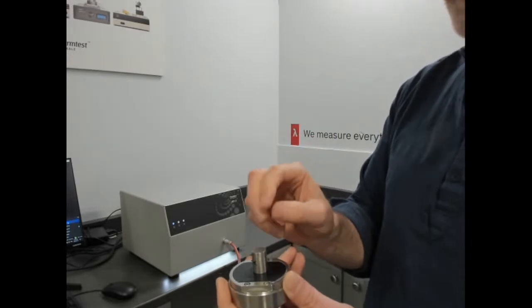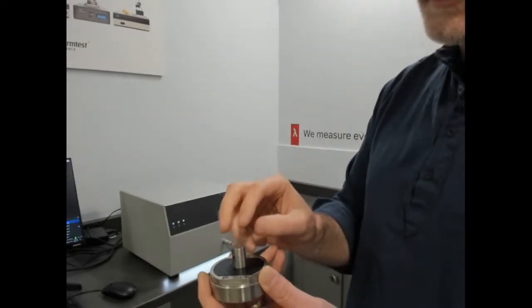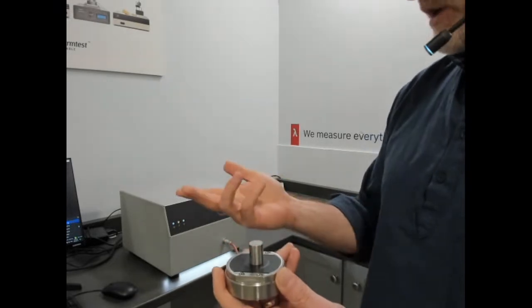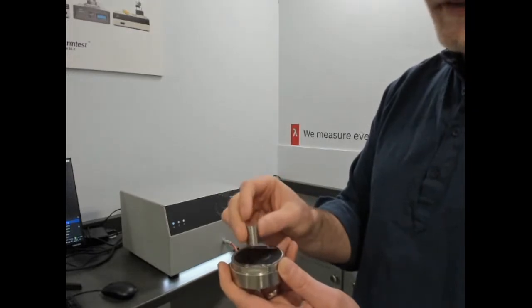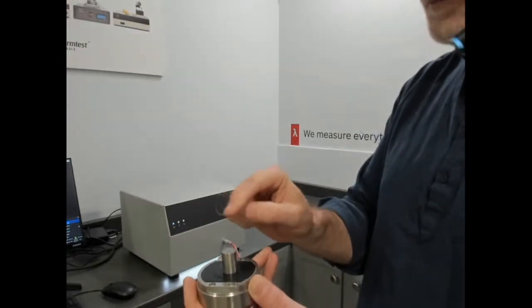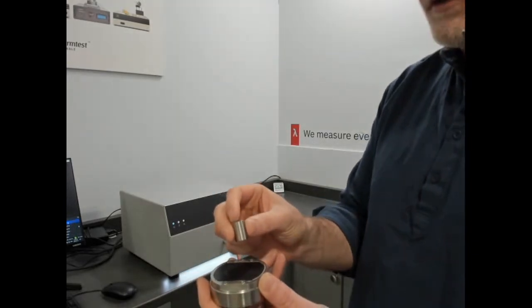This is quite an ideal method for measuring somewhat heterogeneous materials. There are limits to what is defined as heterogeneous and what can be accurately measured. An interesting example that keeps popping up is 3D printed materials. 3D printed metals have some entrapped air, some entrapped oxygen that, even at 99% dense, does give you a conductivity that's different than the intrinsic solid version of the same metal. So in that case, measuring along the length of a defined dimension gives you a one-dimensional value, which is quite ideal when you're trying to characterize one material.